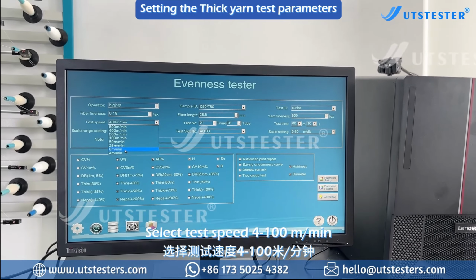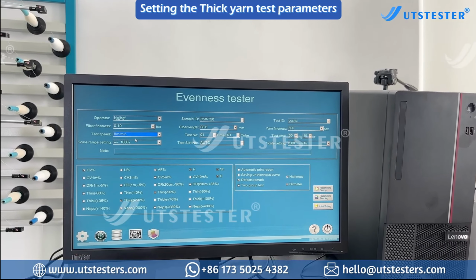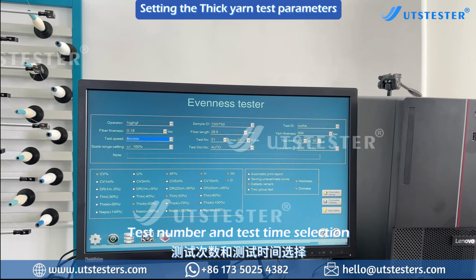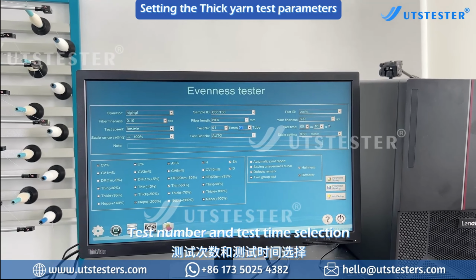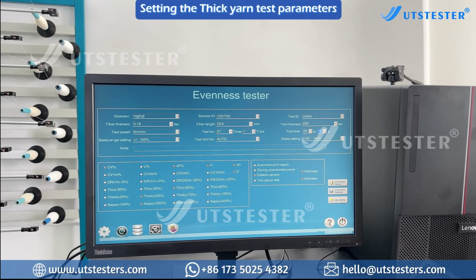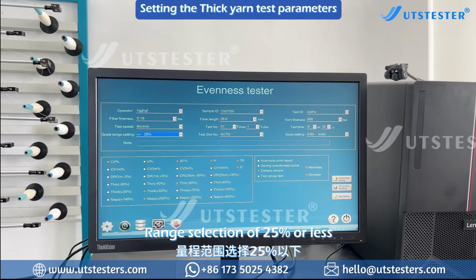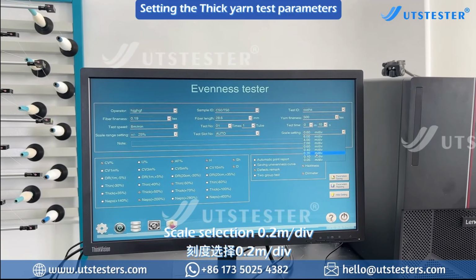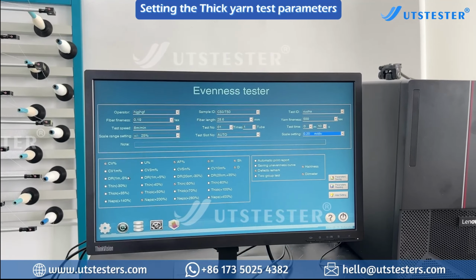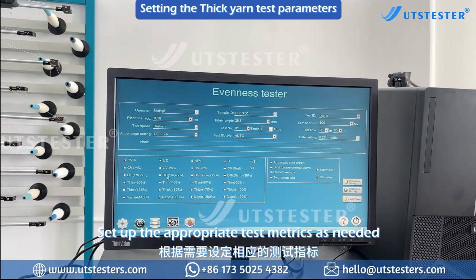Select Test Speed 4, 100 meters per minute. Test number and test time selection. Range selection of 25% or less. Scale selection 0.2 meters per div. Set up the appropriate test metrics as needed.